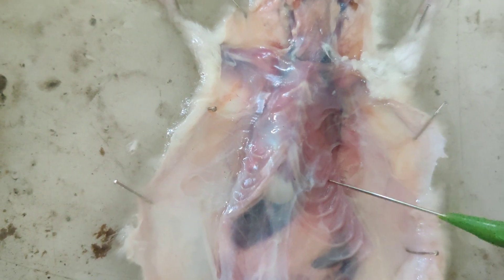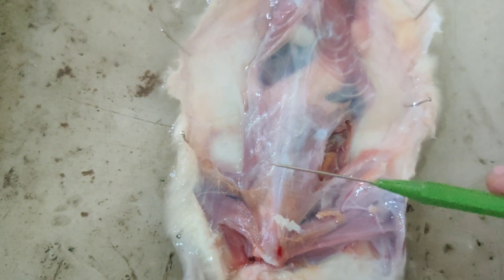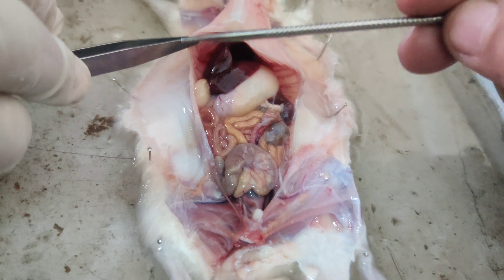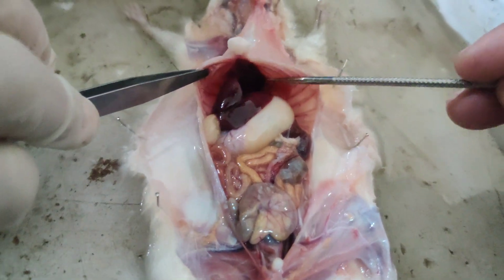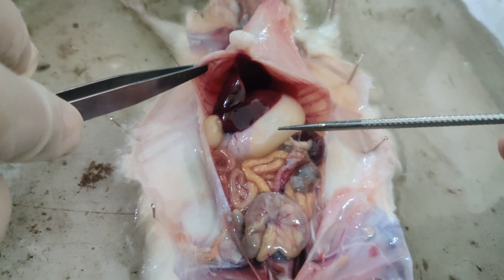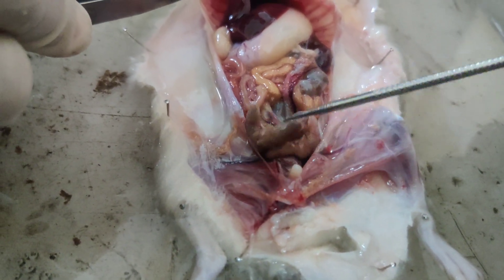Behind this body wall all the organs are located. You can see the ribs — very prominent ribs are there. Now I will cut the body wall to expose all the internal organs. I have opened the abdomen here. You can see the liver, this is the stomach, and these are the small intestines.